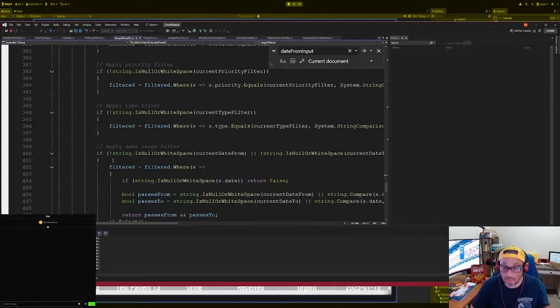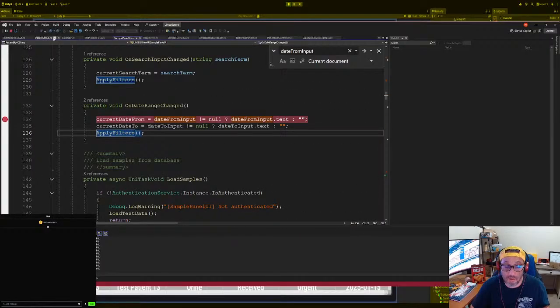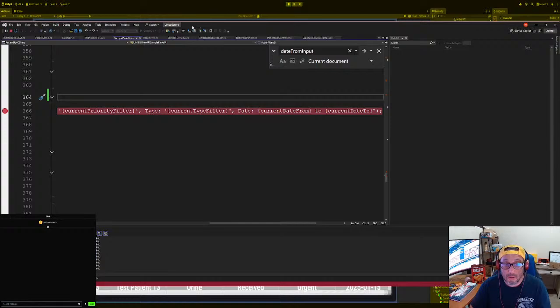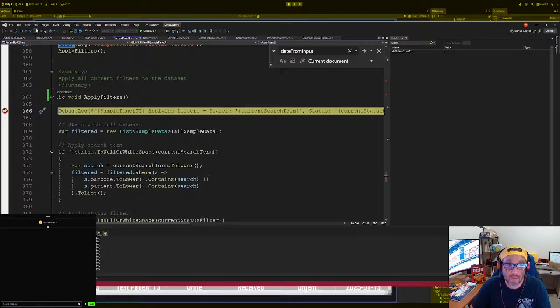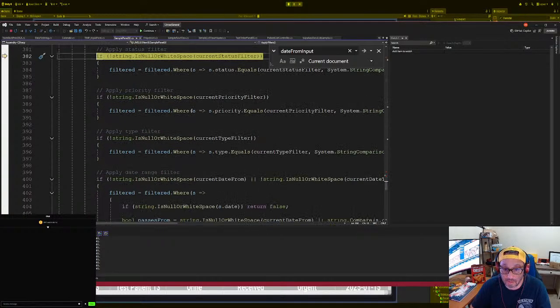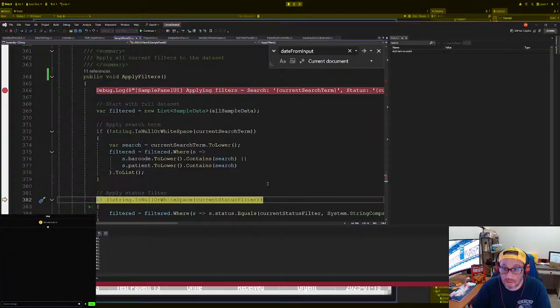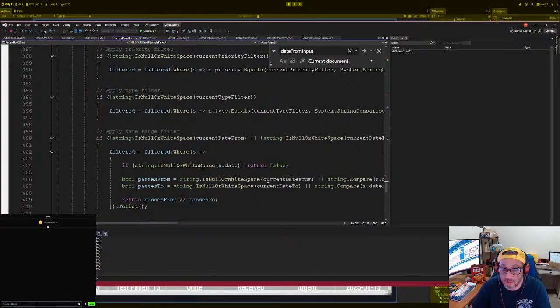Date from. Current date from. Let's do this. All right. Go back. And let's test it again. Okay, it is hitting the apply filters, but it's not hitting the, for some reason, the event from there. But at least we got that working. So let me see, where is that part? It's a different apply filter, right? Current filter, current type, current date from. Oh, we not set a date from.